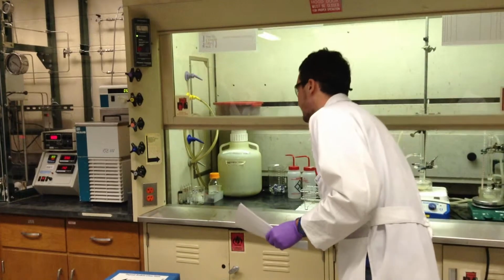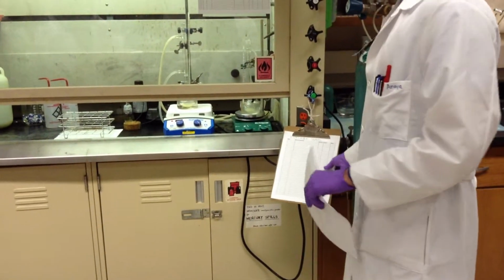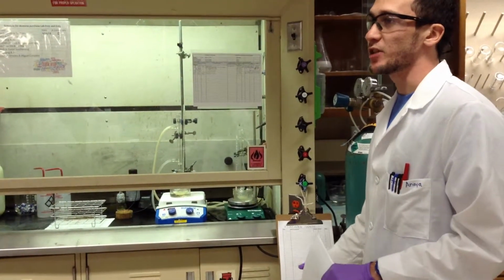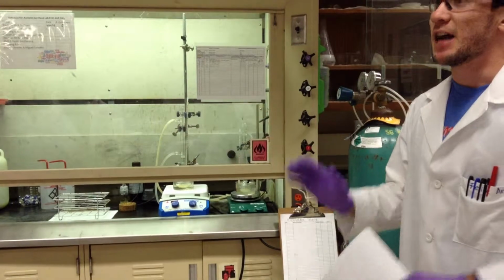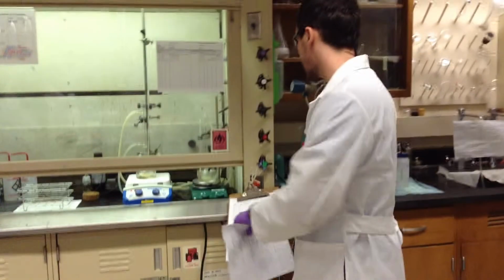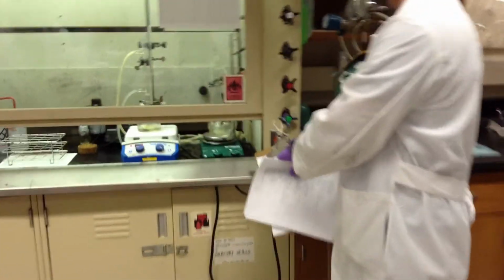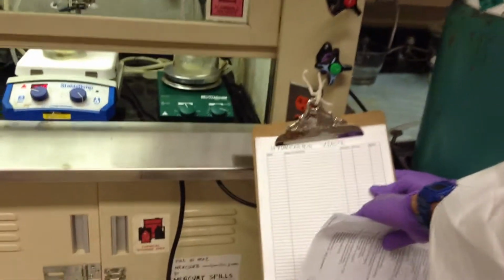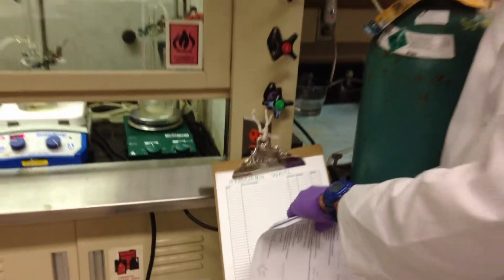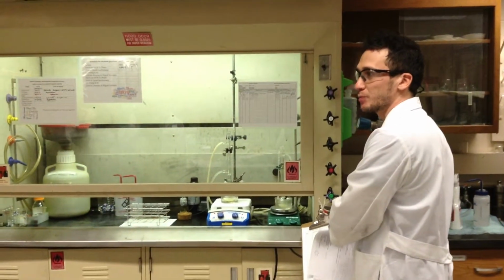In order to do that, we keep in all the hoods a waste sheet to record all the things we dispose of in it. It's pretty necessary that every time you dispose of something, you write the date. Well, there's a form you have to fill out: the name of the chemicals you are disposing of and how much. The chemical and how much. Of course, it's useful if you say who you are, who disposed of that.